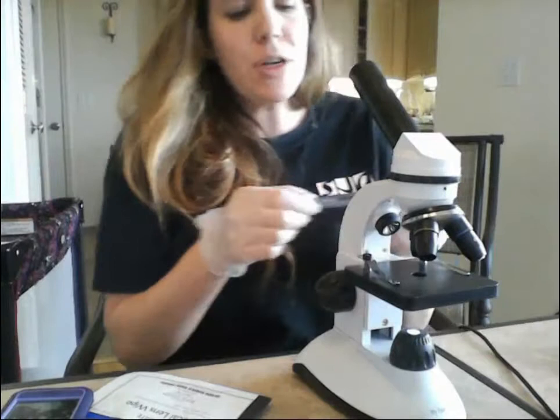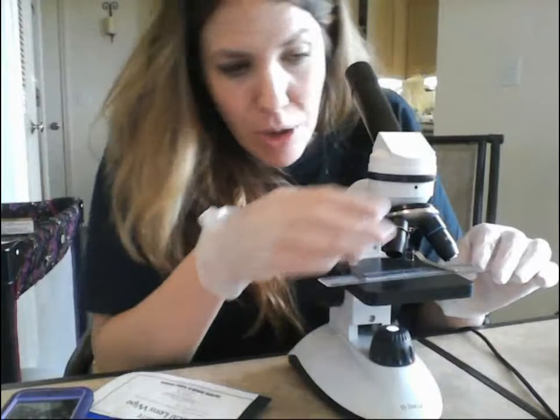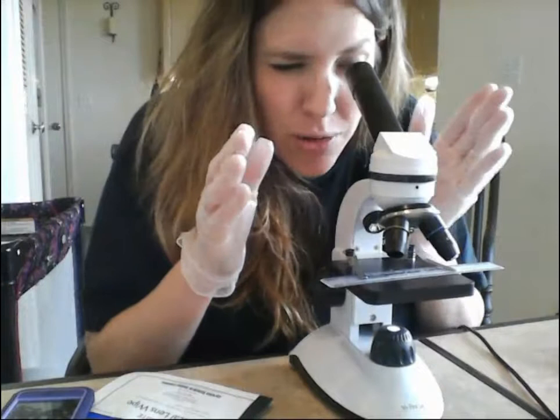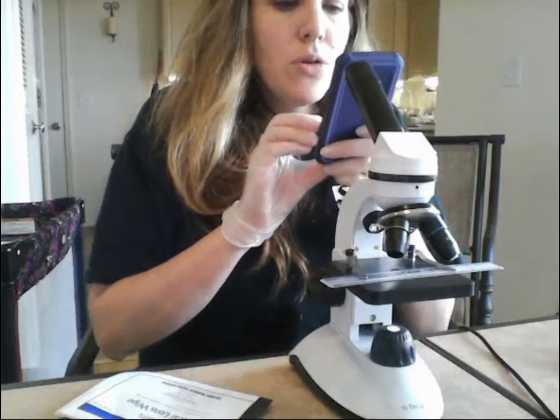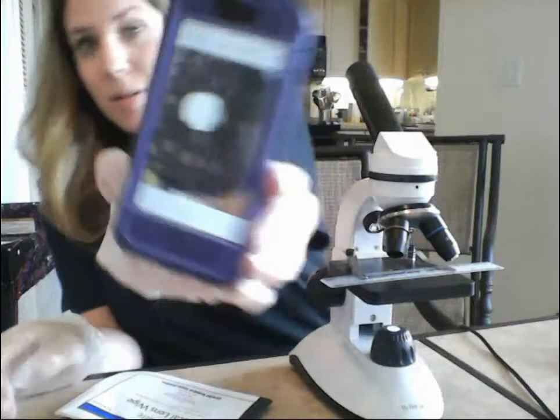The other thing you're going to do is measure your field of view. Put the ruler itself on the stage under the 4x objective, look through and focus it, then count how many millimeters span from one edge of the field of view circle to the other. I'll take a picture so you can see what this looks like — you should see millimeter lines from the ruler in your field of view.